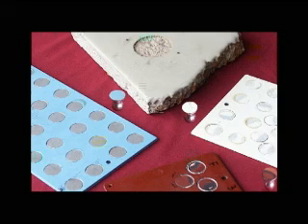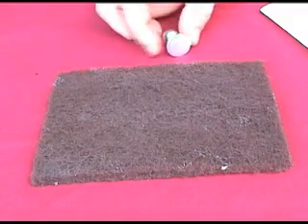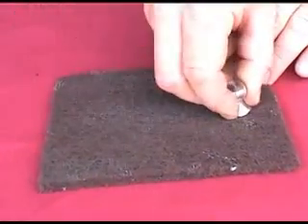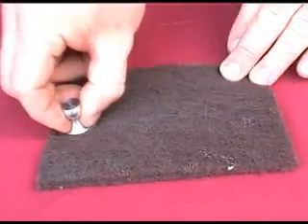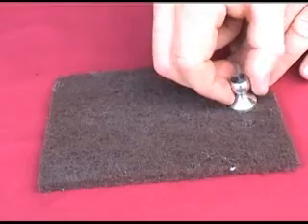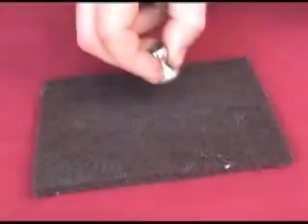To ensure pull-off tests are meaningful, preparation of the surfaces to be adhered is critical in facilitating adhesion between the dollies and coating. Lab tests have shown that for aluminum dollies and the Araldite adhesive, surfaces prepared with a 3M Scotch-Brite pad demonstrate strong, reliable bonds. Any residue generated by the dolly preparation method should be wiped away with a dry, clean cloth or paper towel.